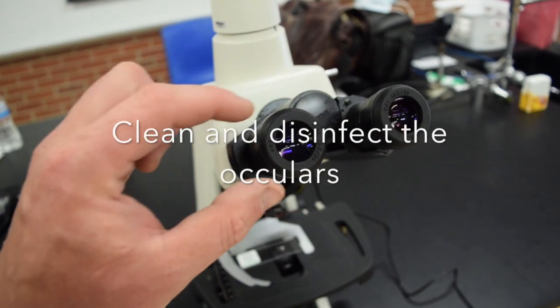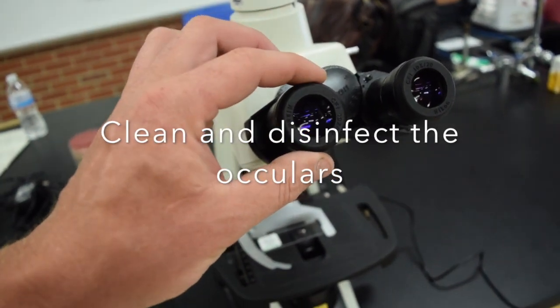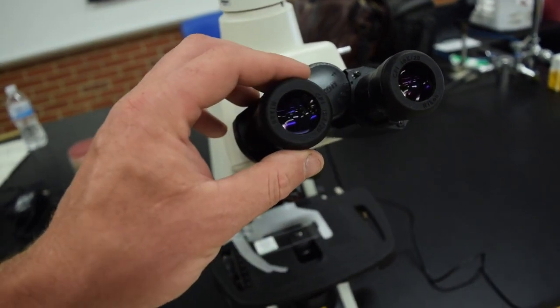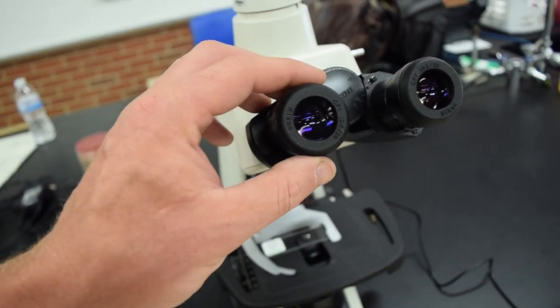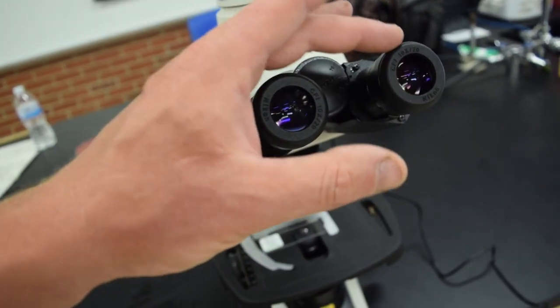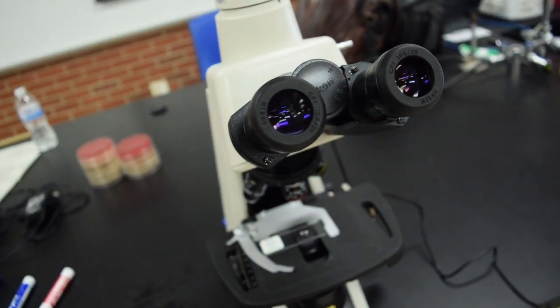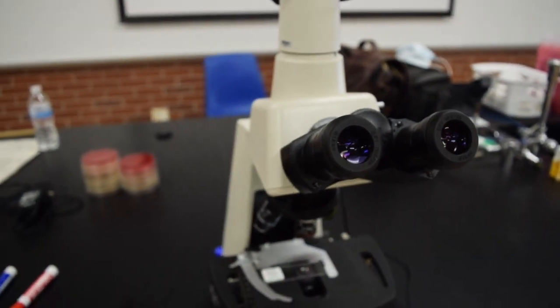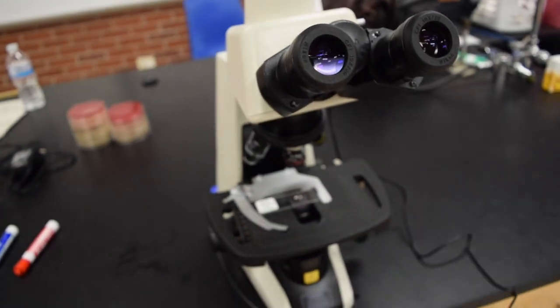One thing I forgot to mention: these ocular lenses - we will have you clean and disinfect them before and after use because your eyes are close to those oculars when you're using them. That concludes the microscope use video.